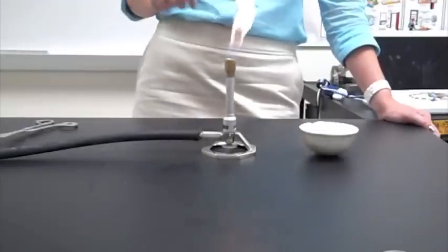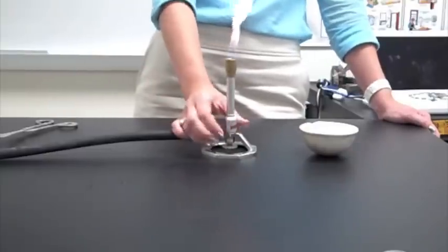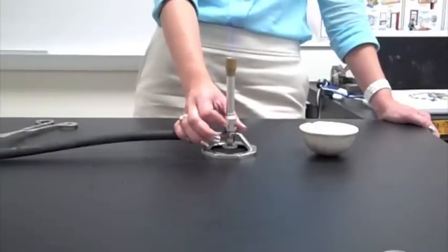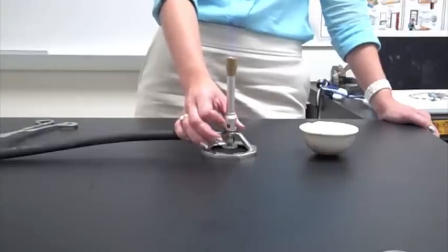Then it tells us to adjust the flame by turning the barrel until the yellow goes away. You can start to hear the roar coming. And you get a nice blue flame. And eventually, you'll start to see an inner cone take shape. That's when it'll really start to roar. And this is the flame that we'll want for most of our experiments. This is the hottest form of a Bunsen burner flame that we can get. If we didn't want one quite as hot, we could just lose that inner blue cone, still keep it blue, but now this flame without the inner blue cone is going to be a little bit cooler. Not much. It's still really hot, but it's definitely cooler than the inner blue cone.